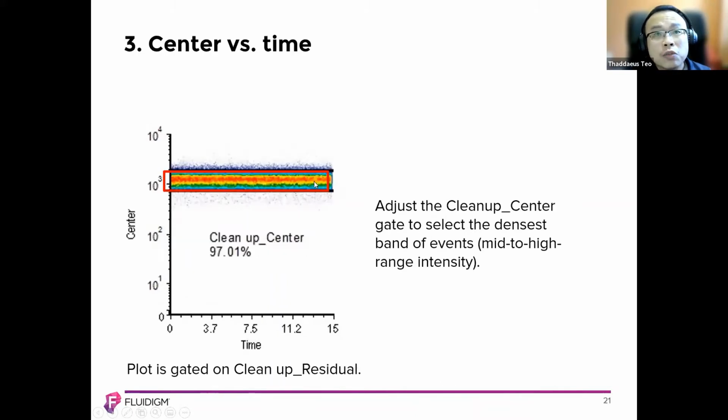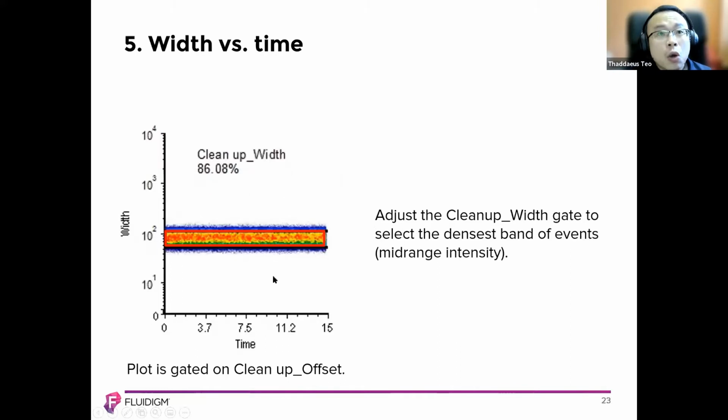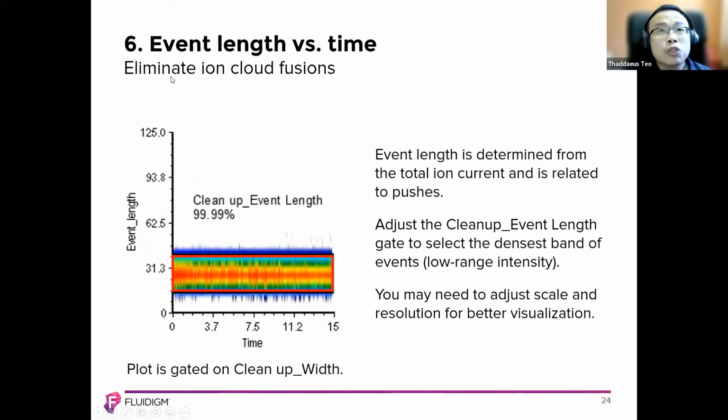This is a bit off. It has to be a bit more centralized in this area. But what I want you to understand is that we select the center, and we remove what's on top and what is below, because we can see that they are basically just doublets, debris, or anything like that. And then we move to offset versus time. We do the same thing to look at the parameters in offset. Then we move on to width, and we clean out the width so that we get what's right there in the center. And finally, we move into event length versus time, and this helps to eliminate ion cloud fusions.